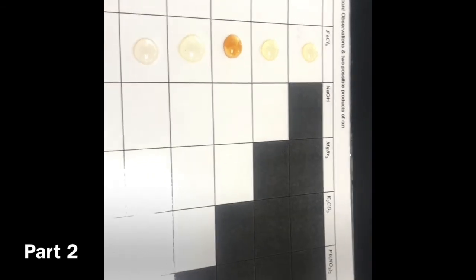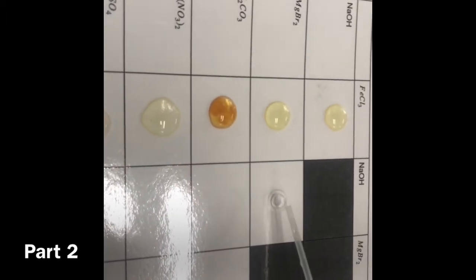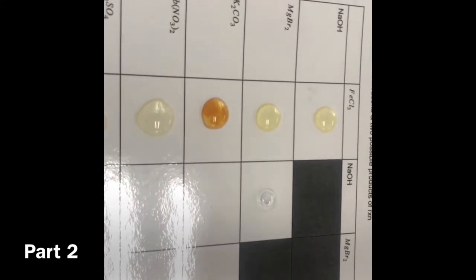Alright, so we got NaOH here. NaOH is not used on the next. Oh, I guess it is. My bad. So we just don't do this at all? Right, because that's NaOH, and NaOH doesn't react with itself. Come on, man. It keeps getting those air bubbles in there. Well, that one's looking awfully clear with an air bubble. You just have to hold that one. I'll just hang on to it.